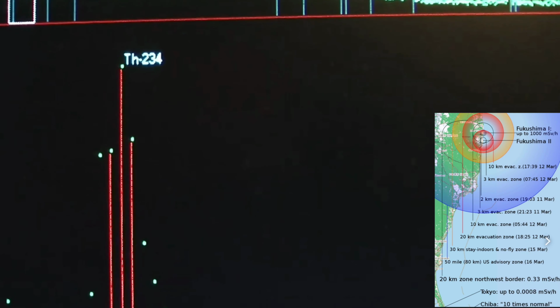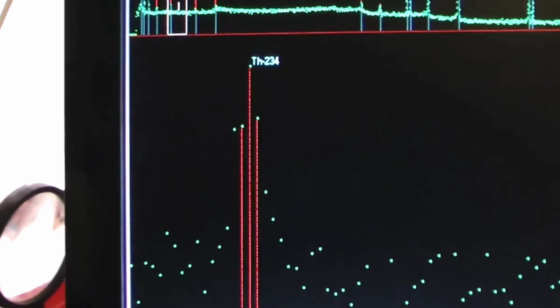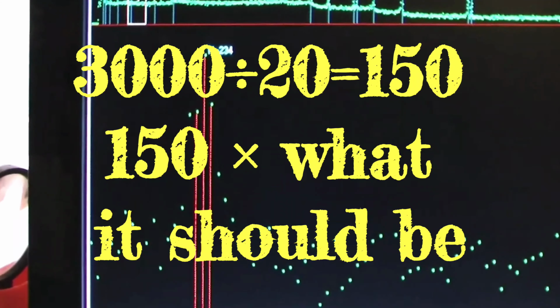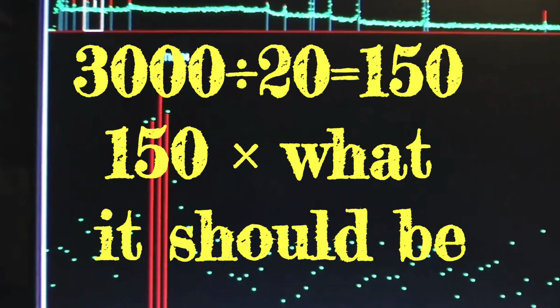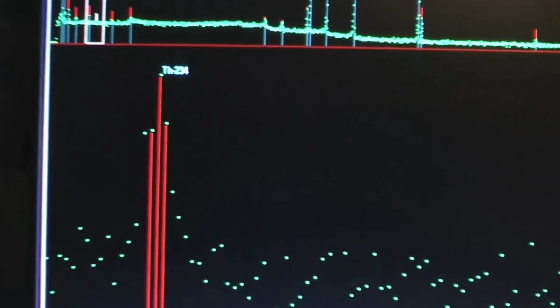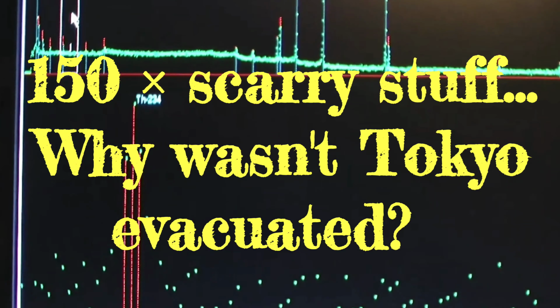Thorium 234. So that's our uranium peak. And there's far too much uranium there. It's about 3,000 becquerels per kilogram. It should be about 20. So this uranium is from Fukushima as well, which means that particles of uranium are floating about in central Tokyo. Scary stuff. Scary stuff.